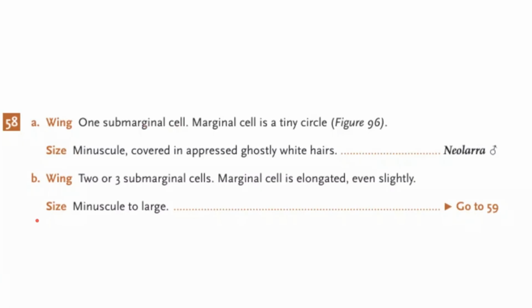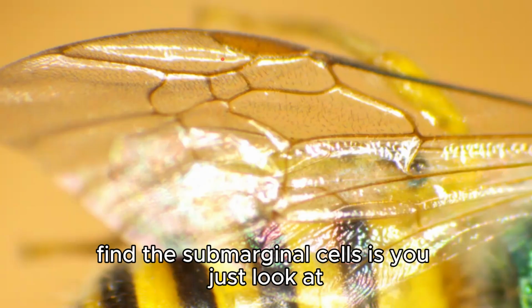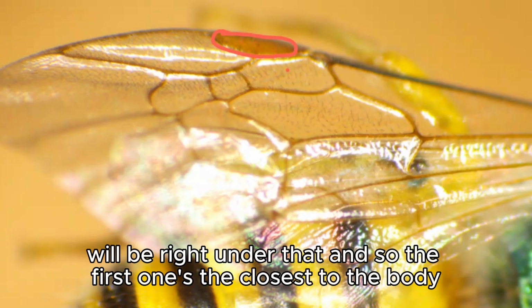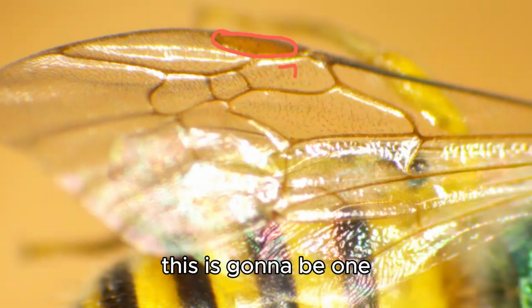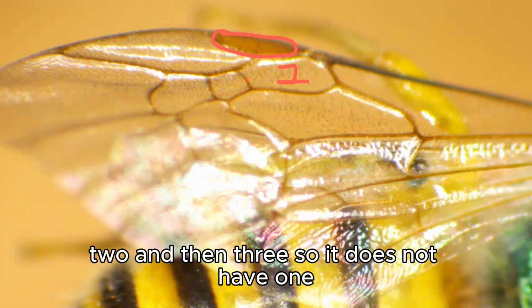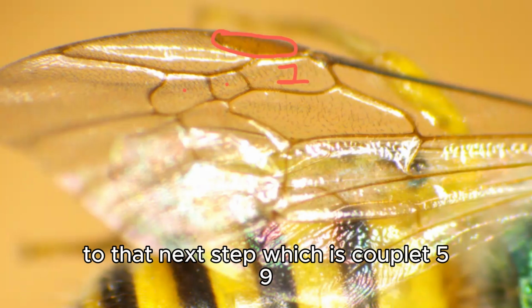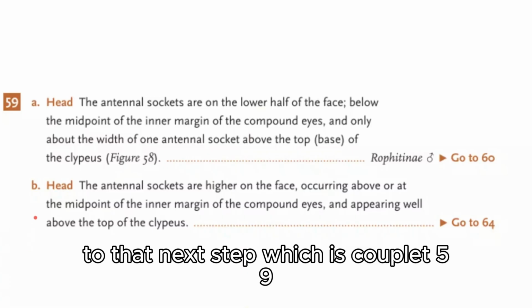And so kind of the easiest way to find the submarginal cells is you just look at where the stigma is at. It's kind of that darkened spot on the wing, and the submarginal cells will be right under that. And so the first one's the closest to the body. This is going to be 1, 2, and then 3. So it does not have 1, and so it has 3, which we'll be moving on to that next step, which is couplet 59.